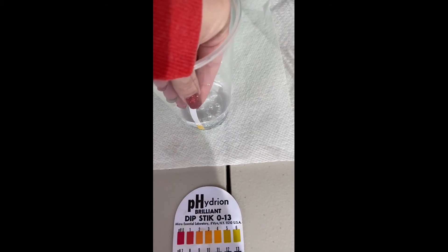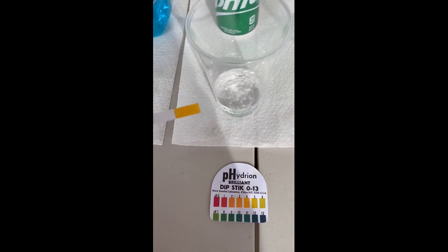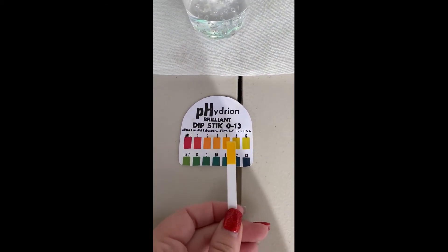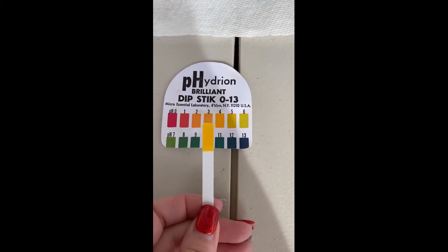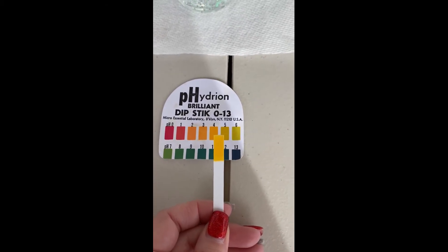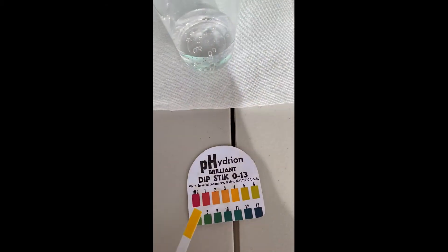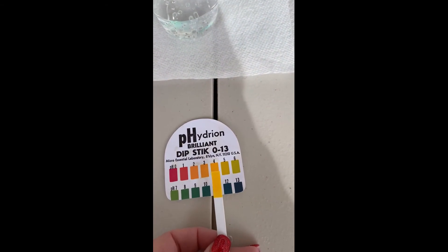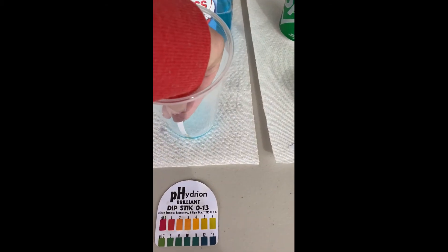Next up, we're going to Sprite. We let it sit here for a second and we can see that comparing it, it's too bright. So I did let it sit just like the other ones, because I couldn't get a good match with it. After a few minutes, I came back to check on it, and this is what it looked like. Comparing these, it's kind of bright — I'm guessing it's somewhere around a 4 to a 5, but it's hard to tell on that one.